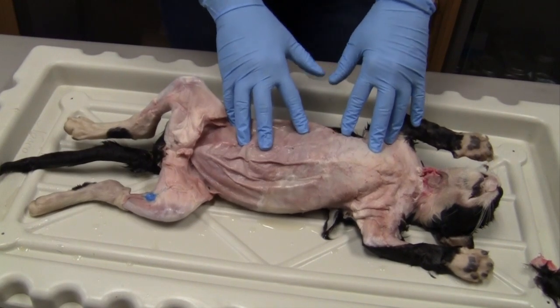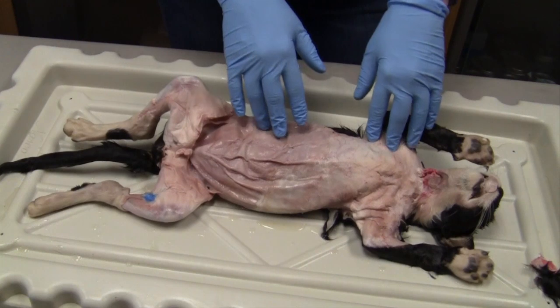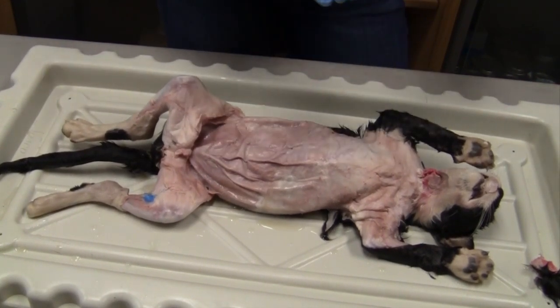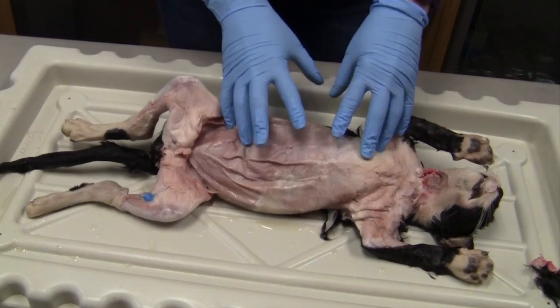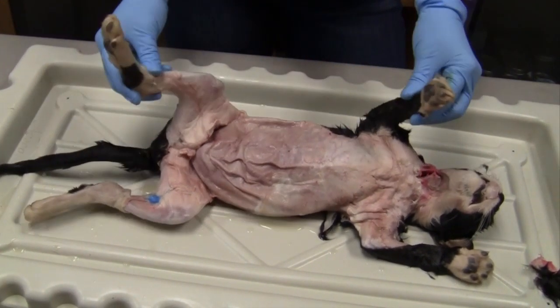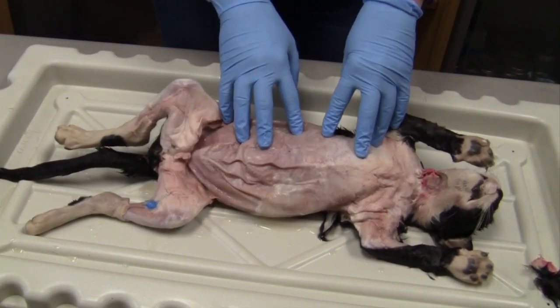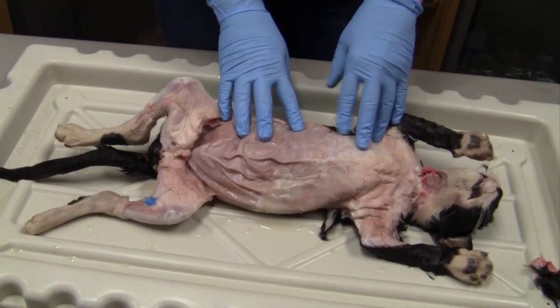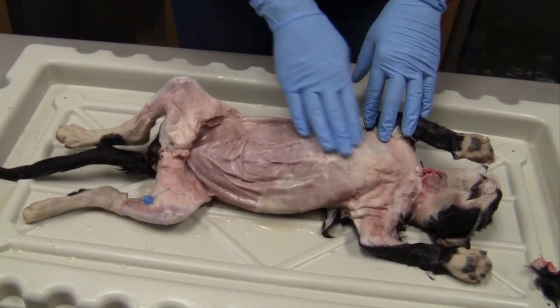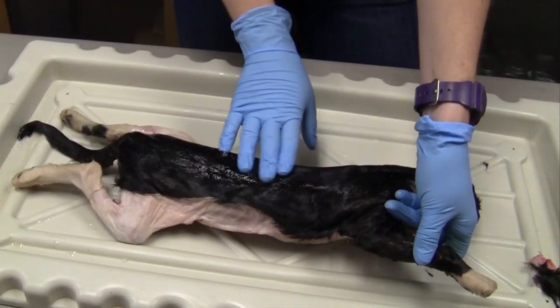I'm sure you have probably heard of anterior, posterior, inferior, and superior, and that's what we use in people, for two-legged animals. When we come to the cat, we have four legs, so we have to have different terminology. We have ventral, which is the stomach side of this cat. We have dorsal, which is the back side.